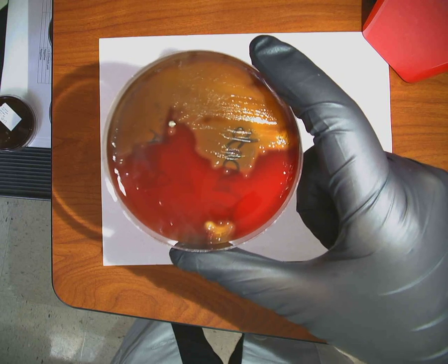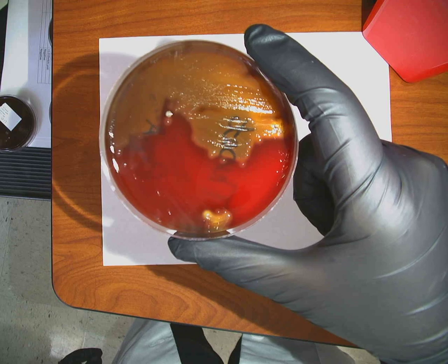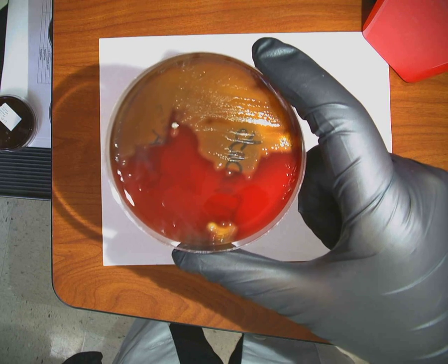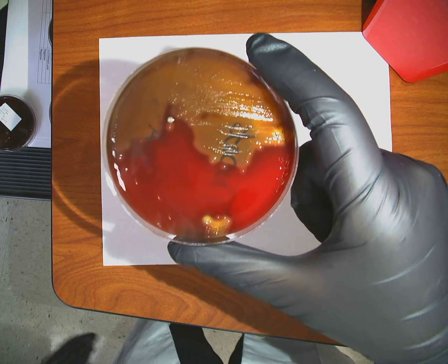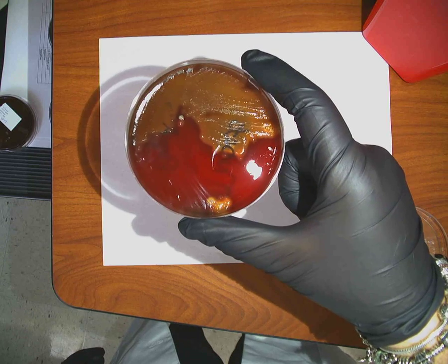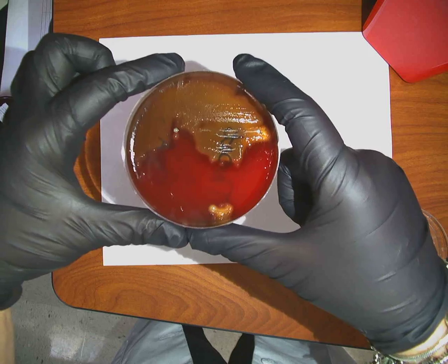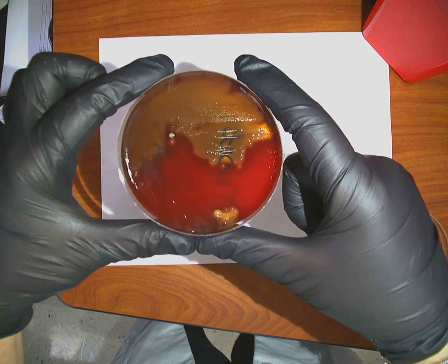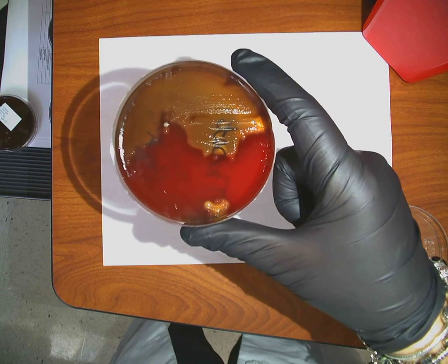It's not Neisseria because Neisseria does not produce this type of hemolysis. It won't do it. Neither will Moraxella. Why do you definitely know this is not Haemophilus? Because it's growing on blood agar. Okay, this is regular sheep blood. So, we know it's not staph, it's not Neisseria, it's not Moraxella, it's not Haemophilus. It's got to be strep, correct?